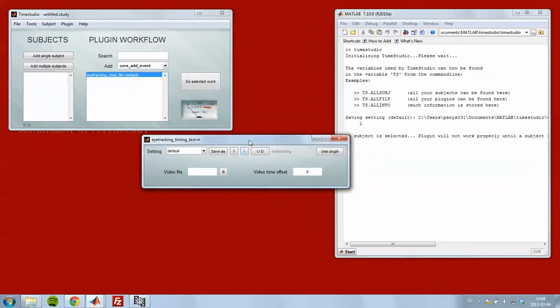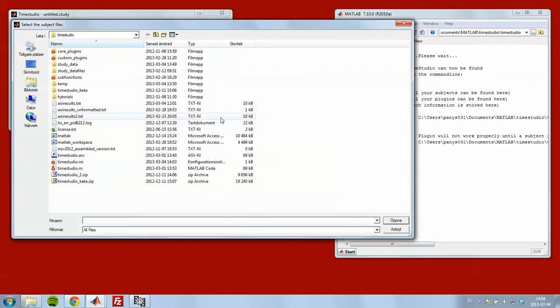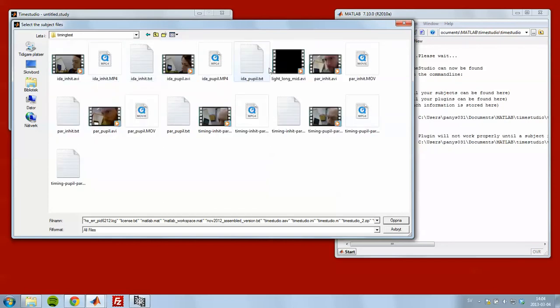When I start this one it says, well, no subject is selected, so the plugin will not work properly until we add a subject. So let's do that. Let's add a single subject. Keep my files here. The timing test. So this file is the output file from one of the two Tobii eye trackers that we use.